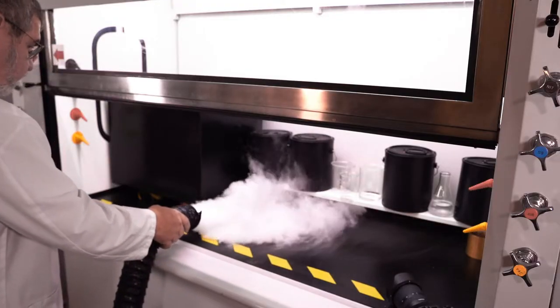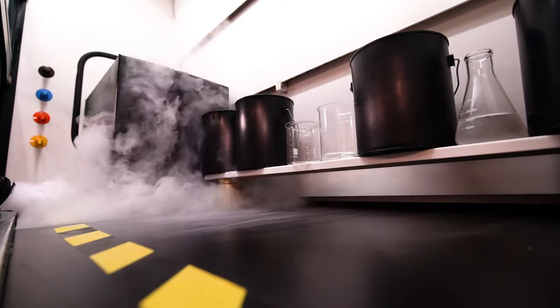Always raise your equipment off of the work surface to ensure air can flow all the way to the back baffles.